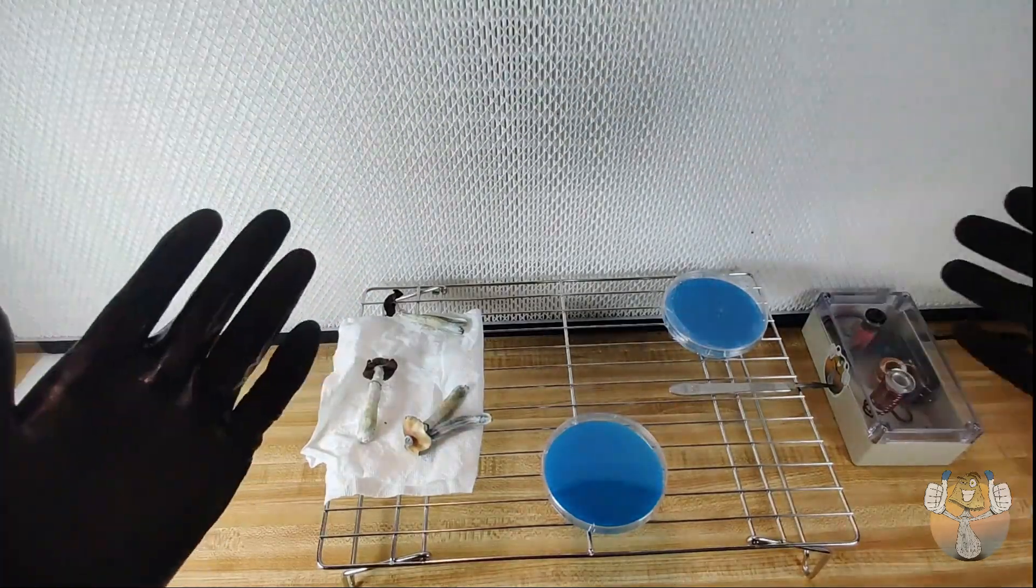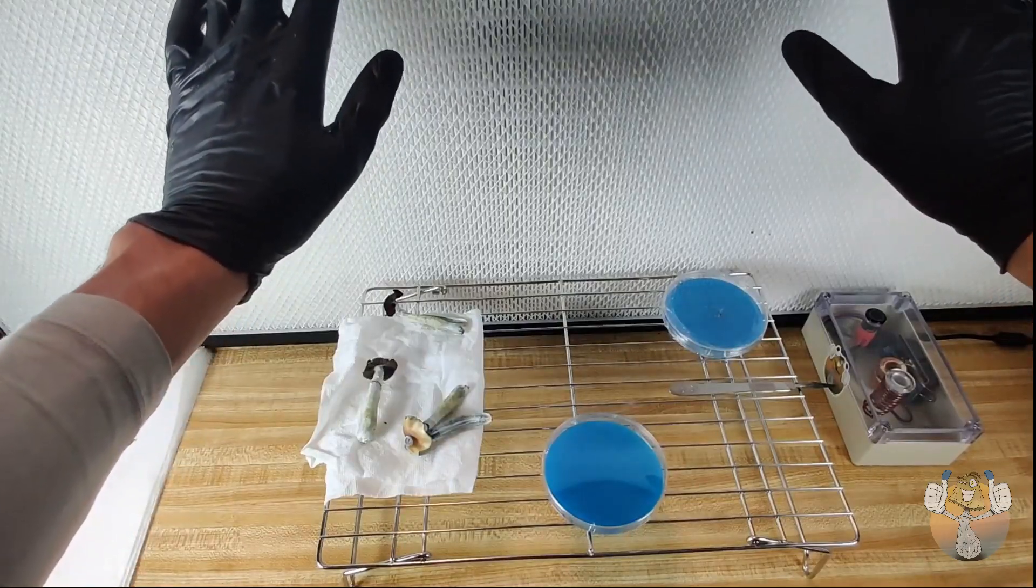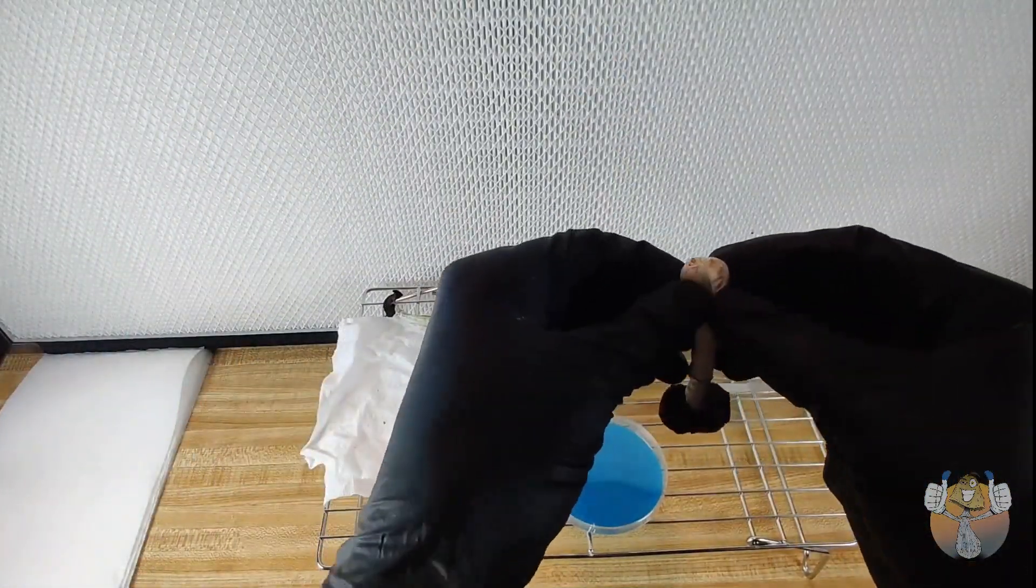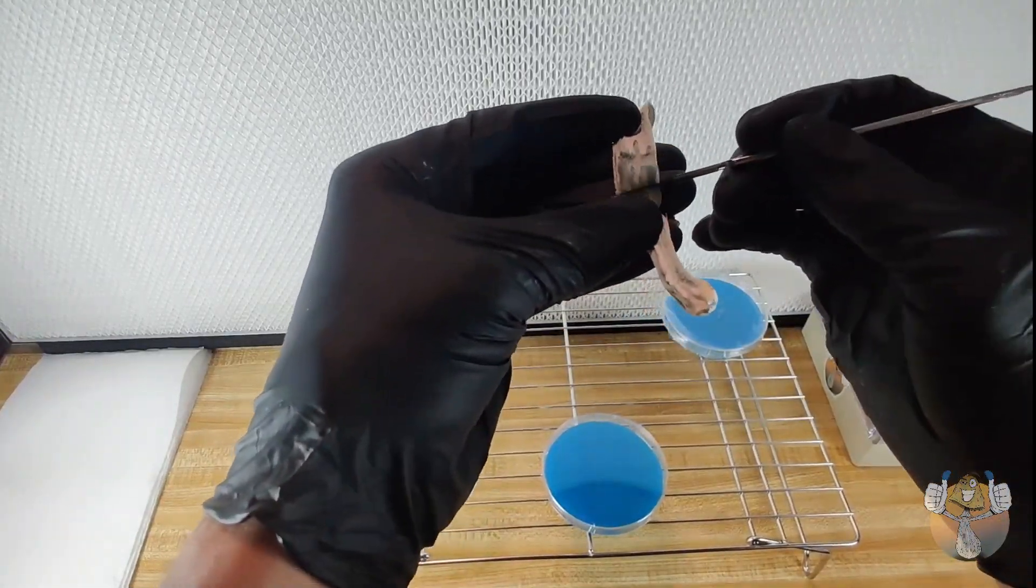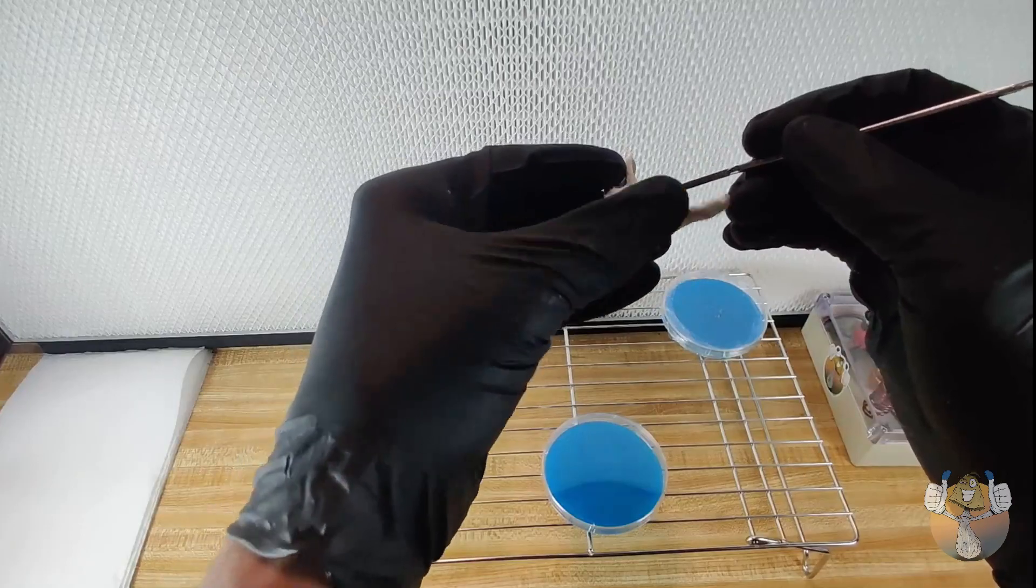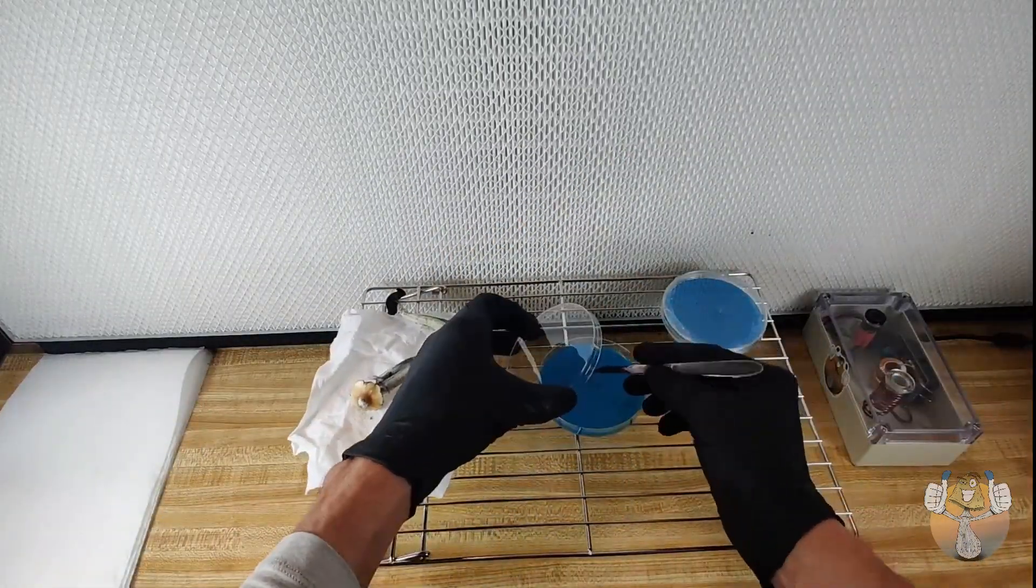Also, I want to recommend if you are cloning more than one fruit, use 70 percent isopropyl alcohol on your gloves, let them dry before you split open the next type. You don't want whatever was on the previous fruit to be introduced to this fresh material.